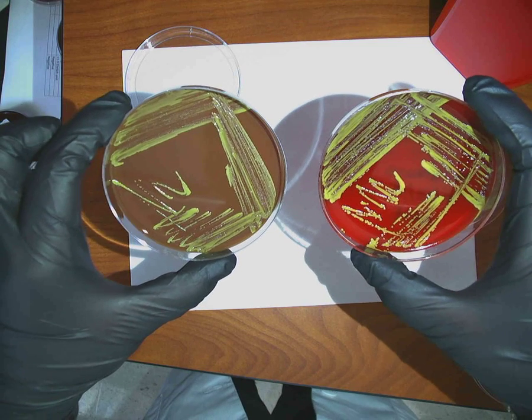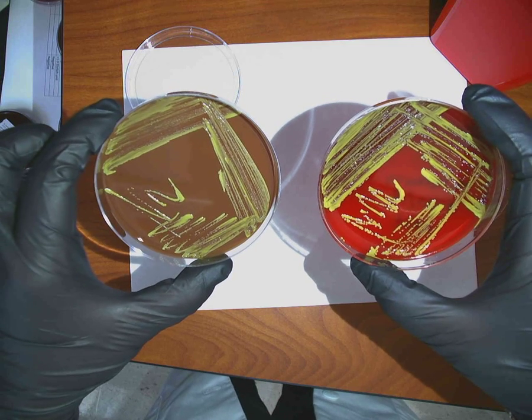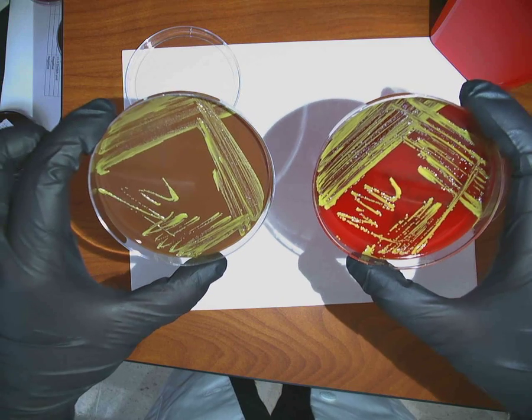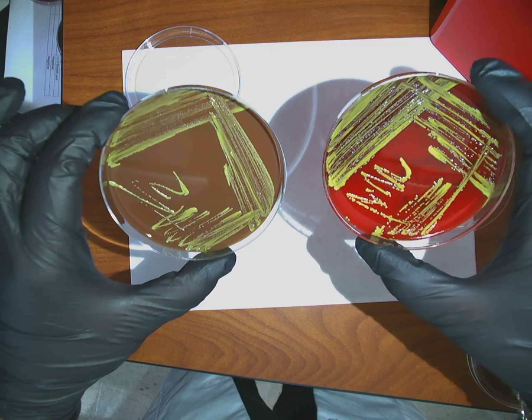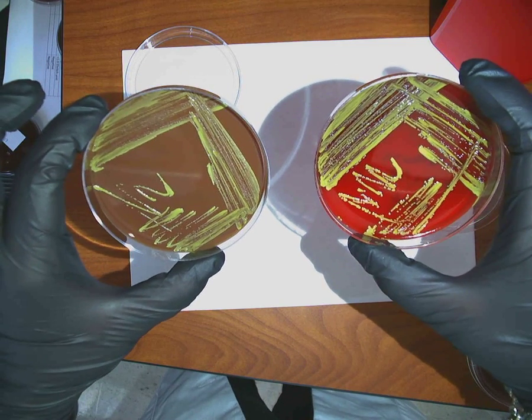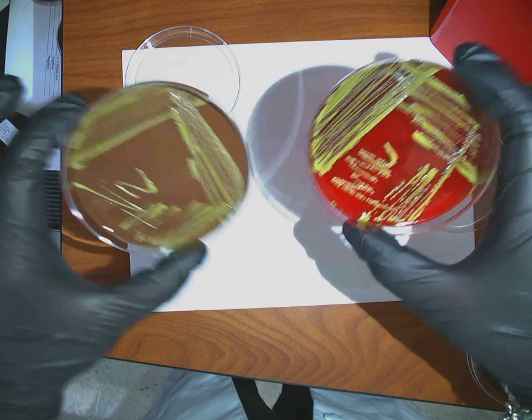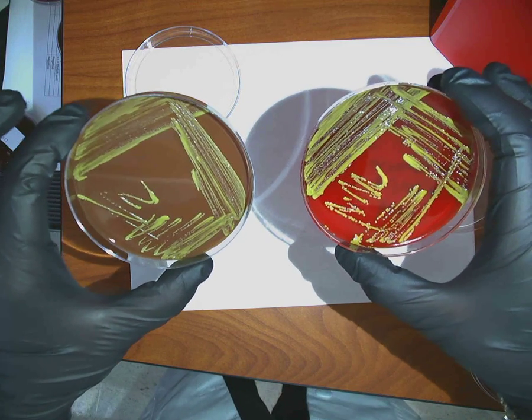It's not Staphylococcus. It's not Streptococcus. It's not what else? It's not Neisseria. It's not Haemophilus. What else? It's not Moraxella. It's yellow. Beautiful golden yellow. Now, it is in the same family as Staphylococcus, right? What is this? Micrococcus. And you know that because of the pretty golden color, right? So, tell me how to identify it, though.